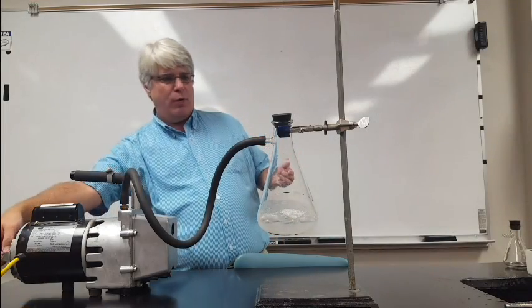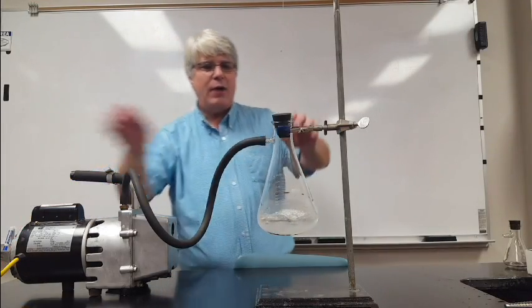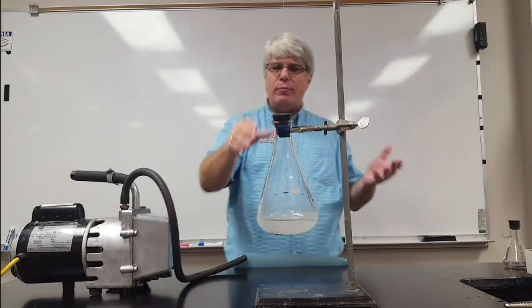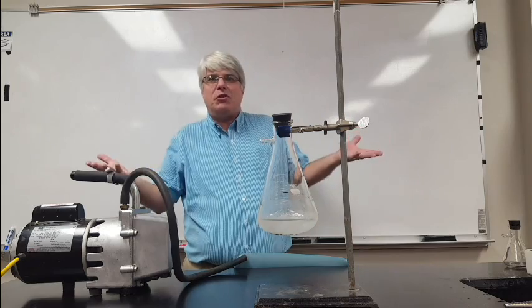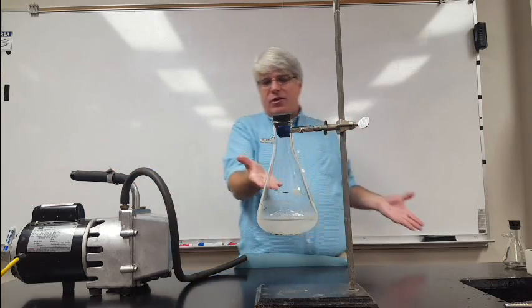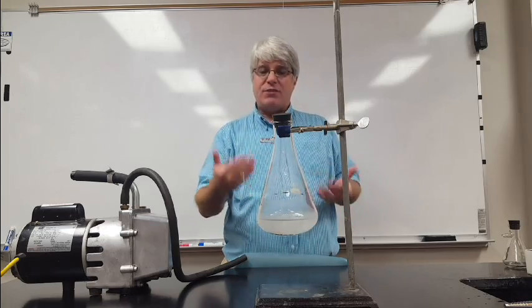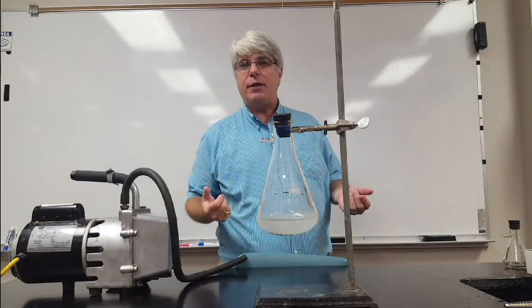Now if I turn the vacuum off and remove it to let air back in, now I'm going back to normal room temperature and pressure. So what happens to the solid? It starts to melt. And so if I leave this here long enough, I'll eventually go back to what I had to begin with—just a flask full of liquid cyclohexane and those boiling chips.